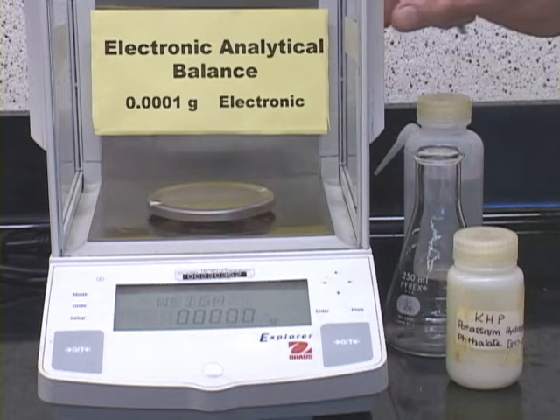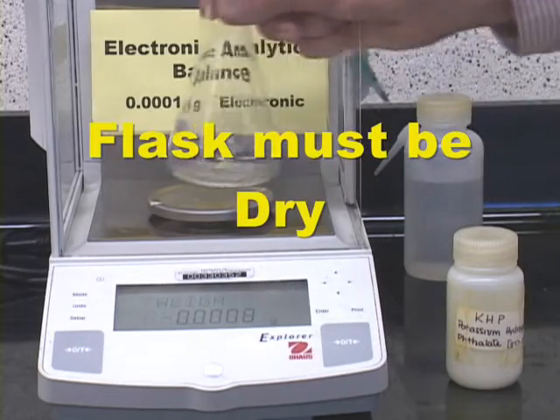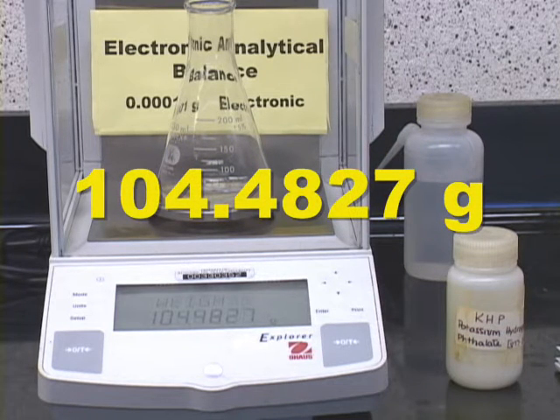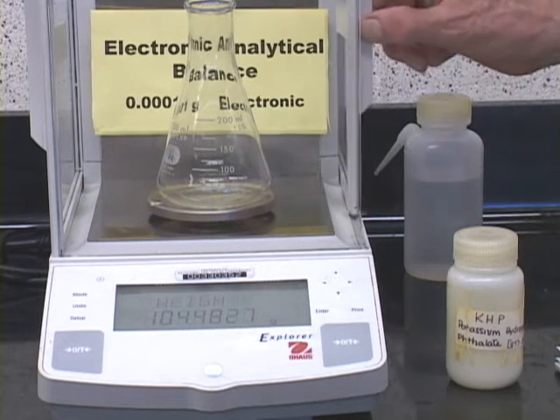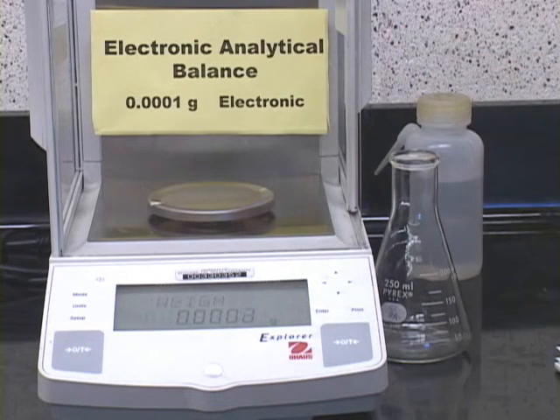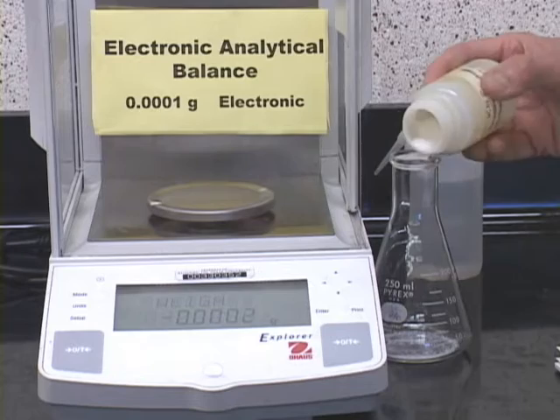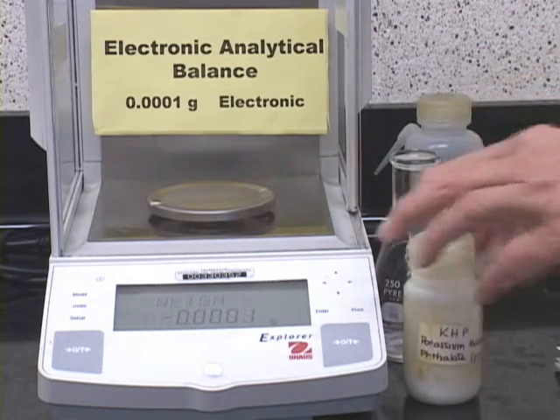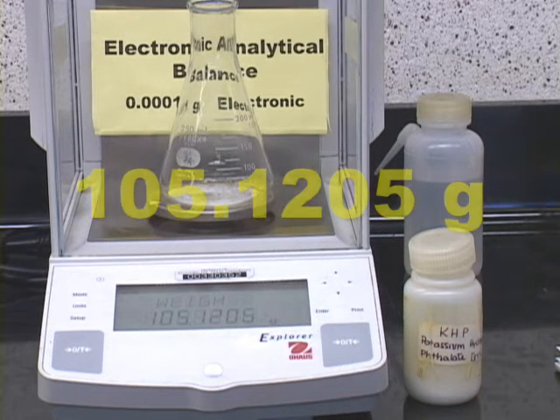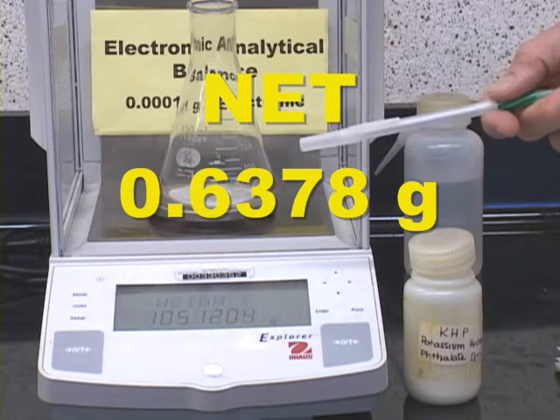Now, we'll be using a rather conservative method for weighing out the KHP here. We will first of all start out by weighing the empty flask. All right, it's 104.4827 grams. And now what we'll do is we will take this flask and we will take it off the balance and add an approximate amount of KHP to this. We'll weigh it again, and there is our weighing here. The difference between this and the first weight is the weight of KHP in our flask.